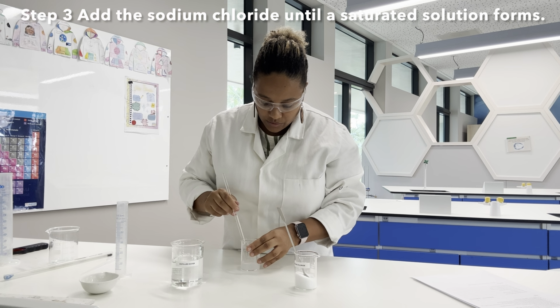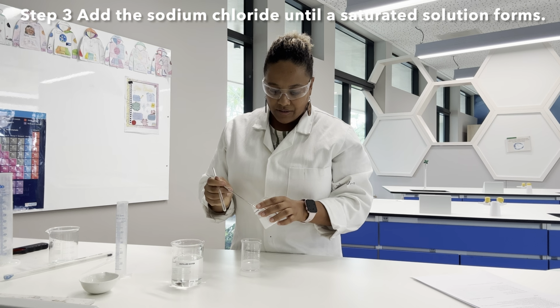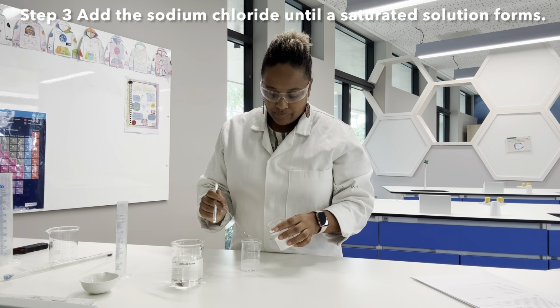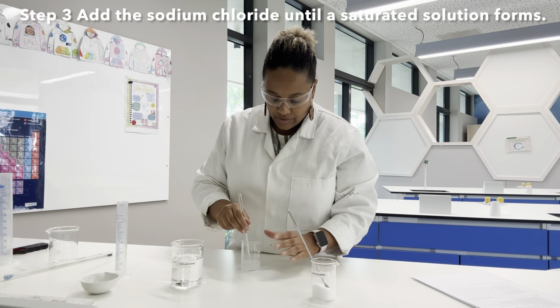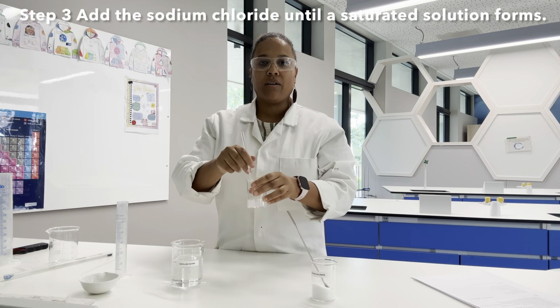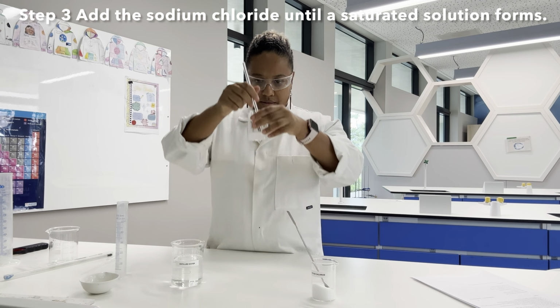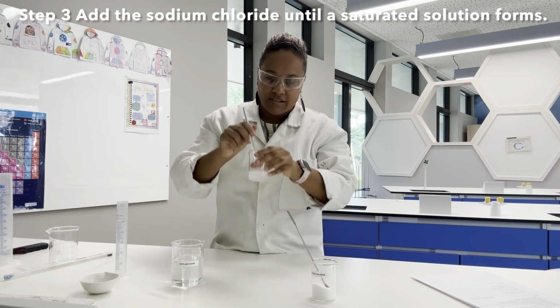So keep stirring till it all dissolves, and I'm going to add another spatula full. And I'm just stirring with my glass rod until we get a saturated solution.